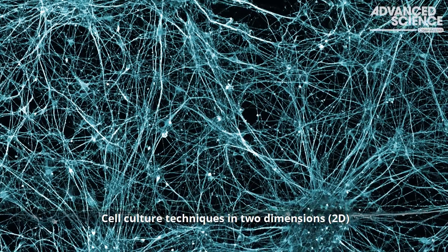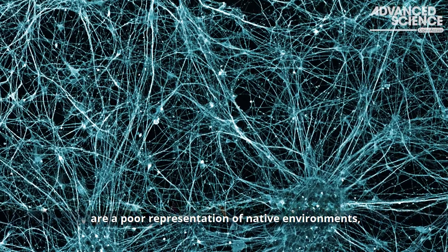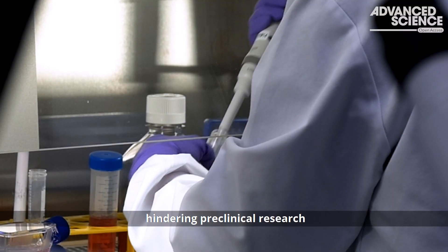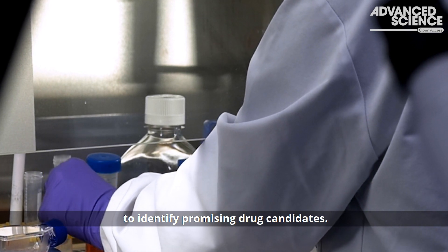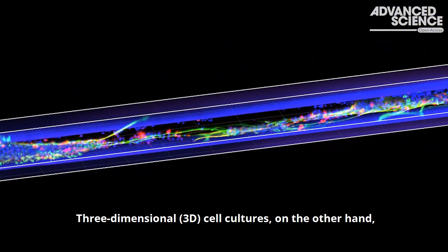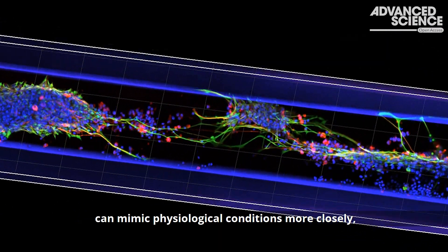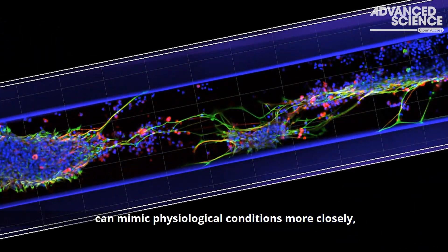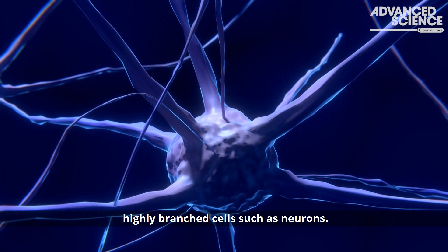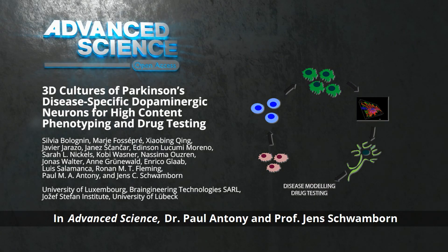Cell culture techniques in two dimensions are a poor representation of native environments, hindering preclinical research to identify promising drug candidates. Three-dimensional cell cultures, on the other hand, can mimic physiological conditions more closely, making them more suitable to model highly branched cells such as neurons.